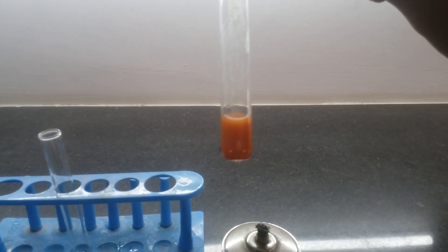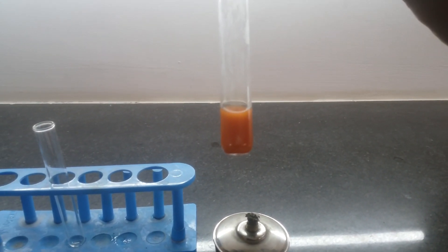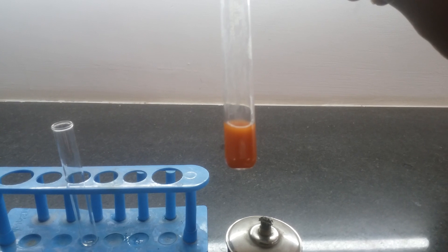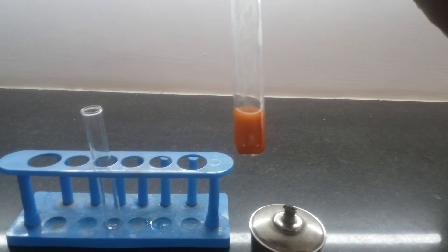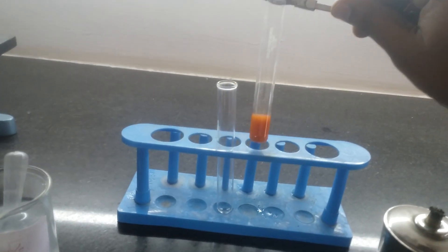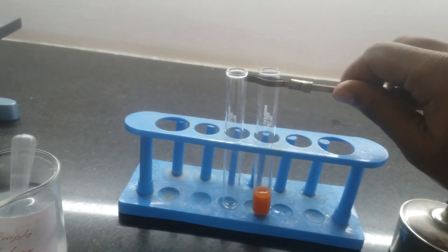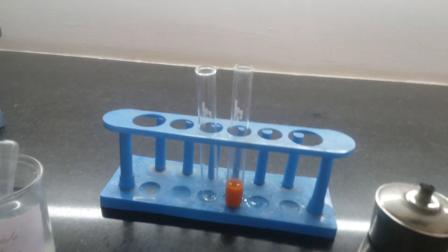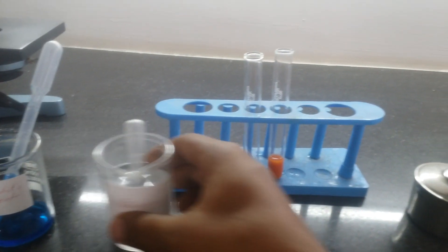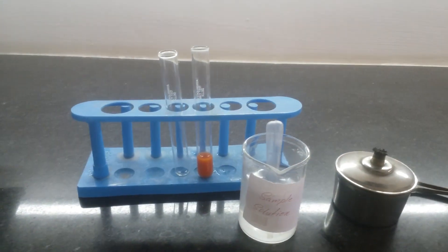It has now changed to brick red color. This change in color indicates the presence of carbohydrates, particularly glucose, in the given sample solution.